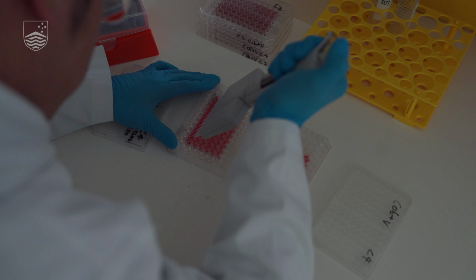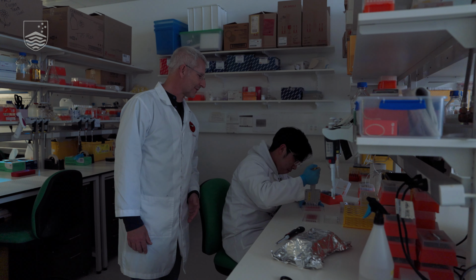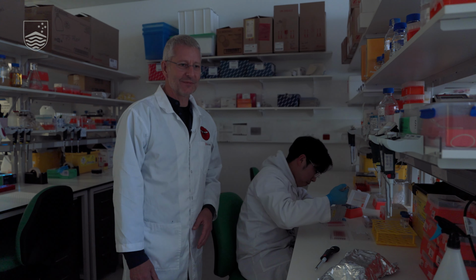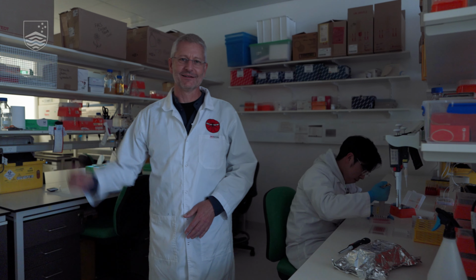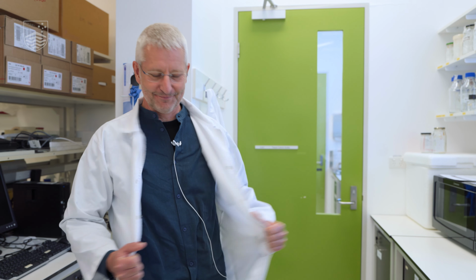Okay, thank you, Sam, for explaining what you are doing with the parasite and how you determine how well different drugs work against the malaria parasite. To move on, we switch on the light again. Before, we looked at malaria parasites that were dead, and now we are looking at malaria parasites that are alive, and therefore we have to go into our culture lab over here, and for that we have to change the gowns again.